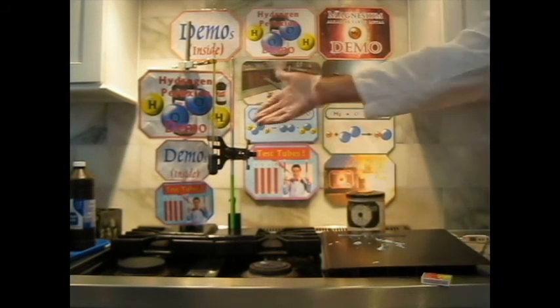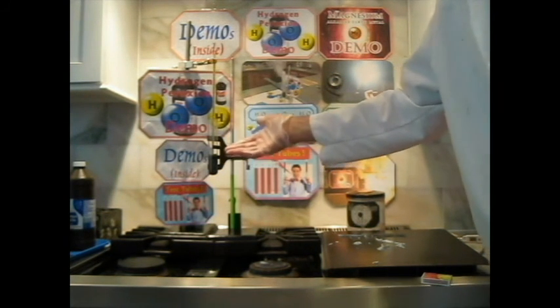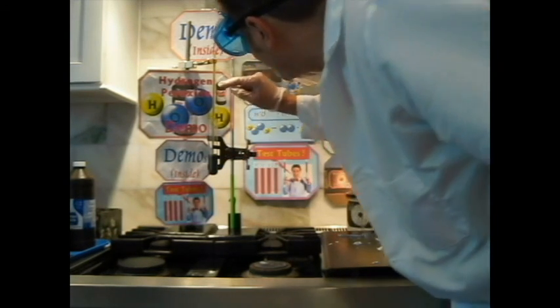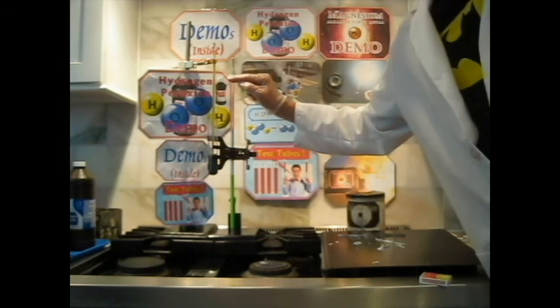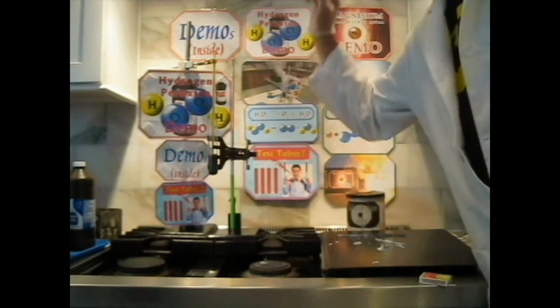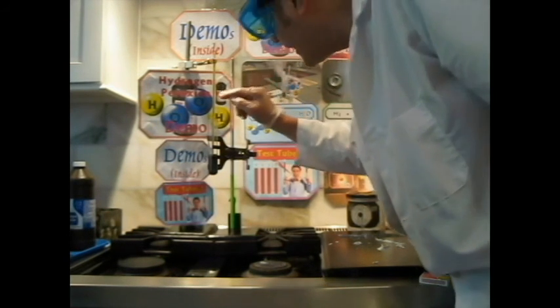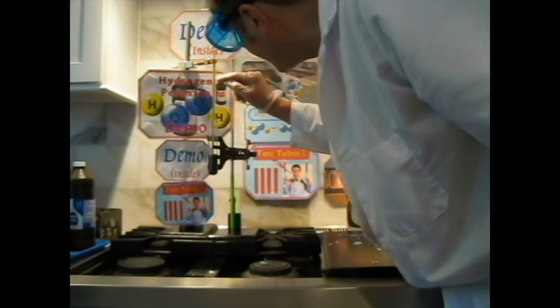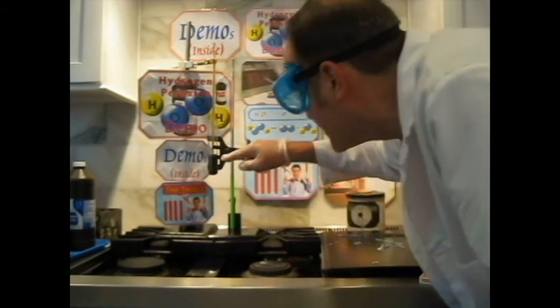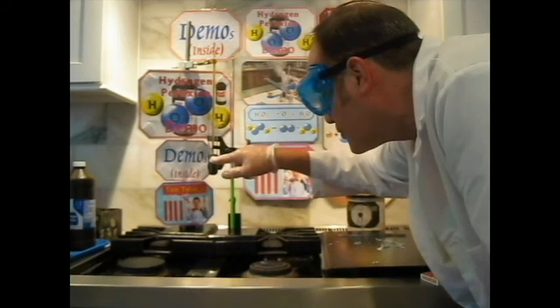Okay. The other one, of course, was the hydrogen peroxide that we did first, and that reaction is now pretty much over. So look over here. What's left? Oh, no, it's still going. And our temperature, oh yeah, look, 85 degrees. It reached 85 degrees Celsius, so it took a while to get there. I think that might be the maximum temperature for the hydrogen peroxide, about 85 degrees. Yeah, because now it's going down to 84. And it's actually still bubbling just a little bit in there, getting close.